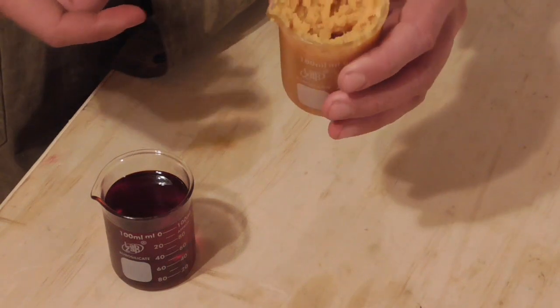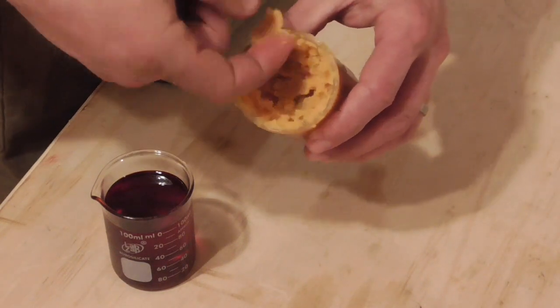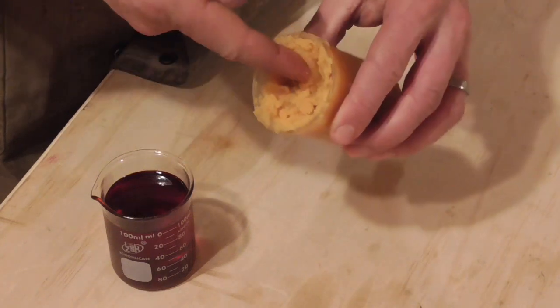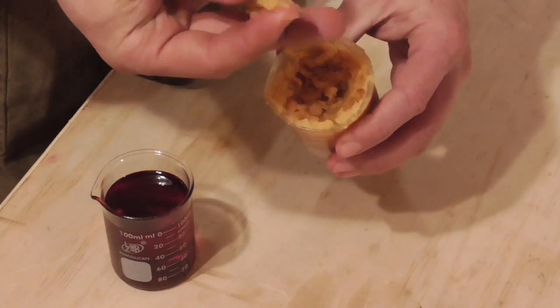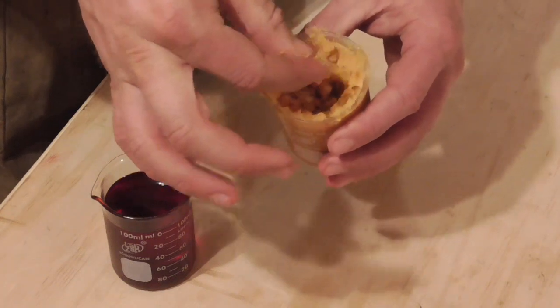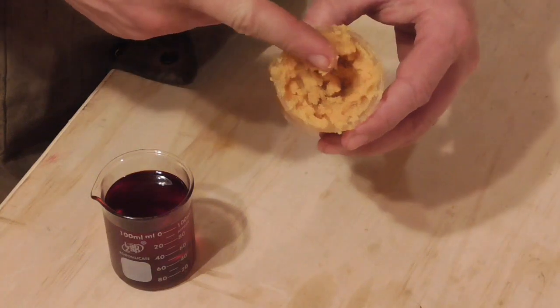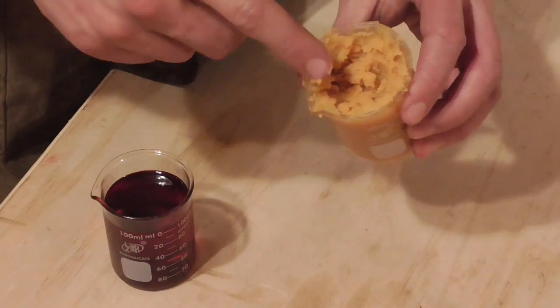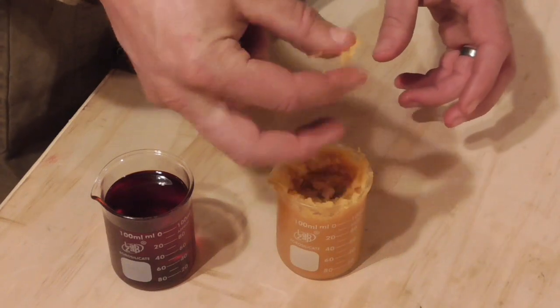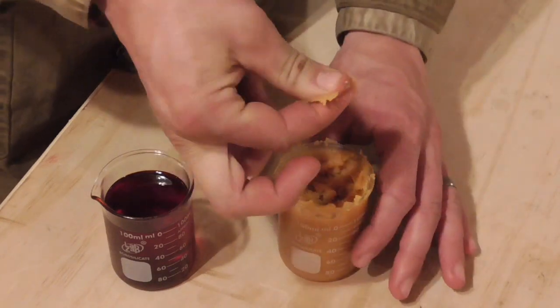This is a solid at room temperature, although it's not a hard solid. It's sort of a paste. I can mold it and squish it and rub it between my fingers, and it feels slippery. It feels soapy. It actually feels a little bit sticky too, kind of like grease, or maybe halfway between soap and grease in its consistency.